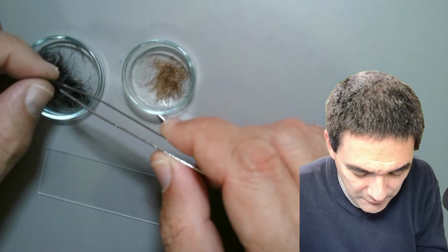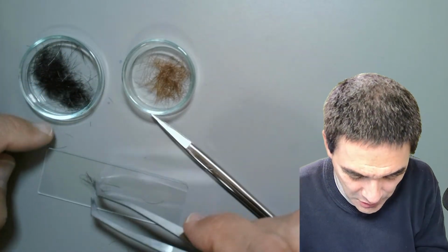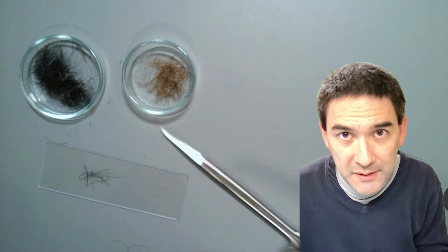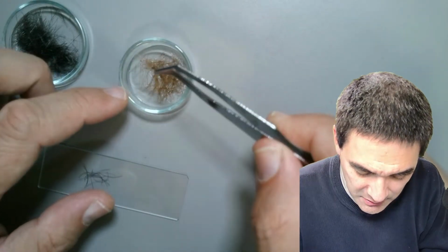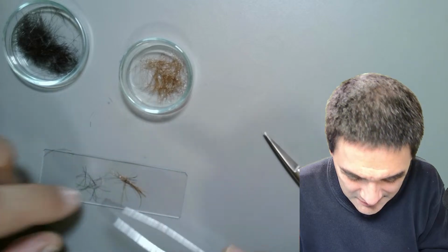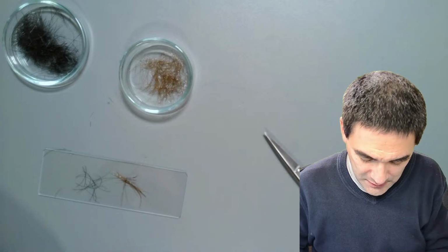If you have problems adding water to your sample because your sample is too hydrophobic, and animal fur, for example, is a case here, then you should use oil. But this one is fine. I know it's a little bit sloppy to have them both next to each other. I usually do the following.